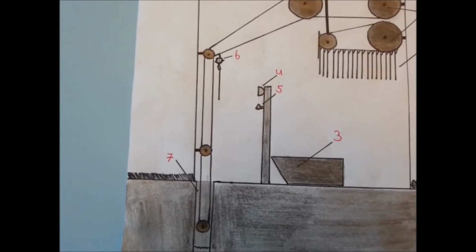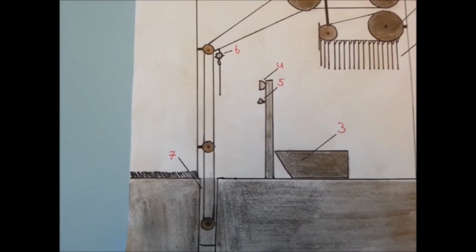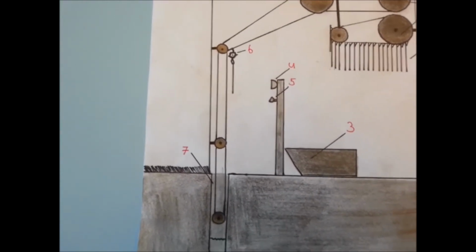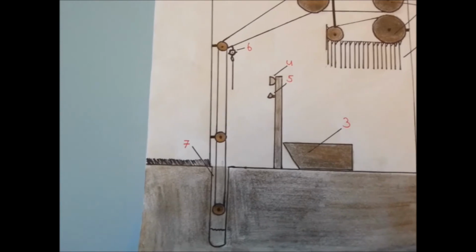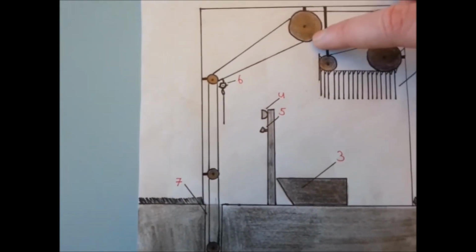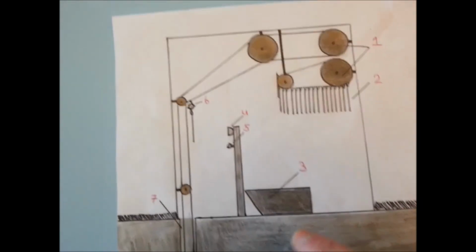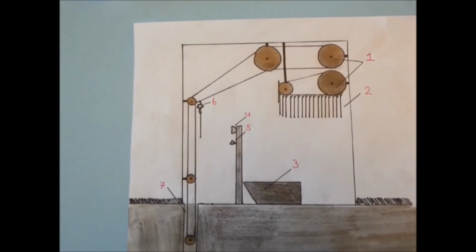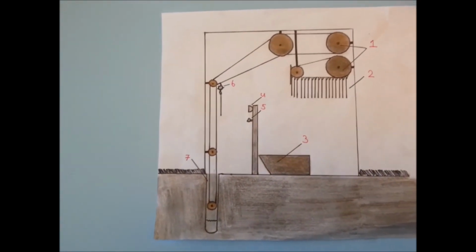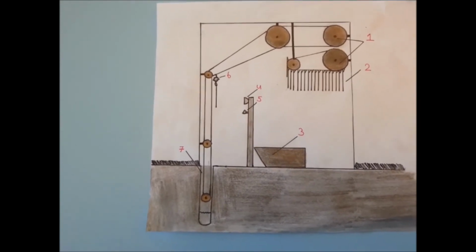So the strip will get picked up, will get transported into the groundwater, then it will stop in the position it is located now, and then number 4, which is the camera, will take a picture of it, and there will be a stable light source, which is number 5. Then it will send the data to the farmer, and then the strip will stop right here. It will drop the strip into the strip container, which is number 3, and then the whole process can start over again. So this is basically the whole process which we've come up with so far in this theme on how to automate soil analysis.